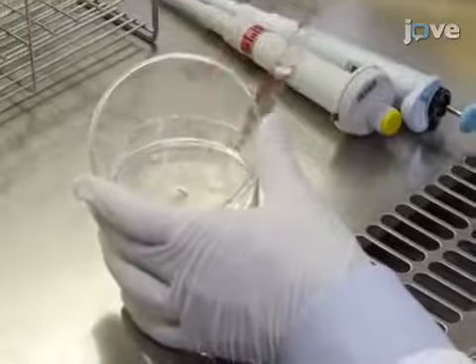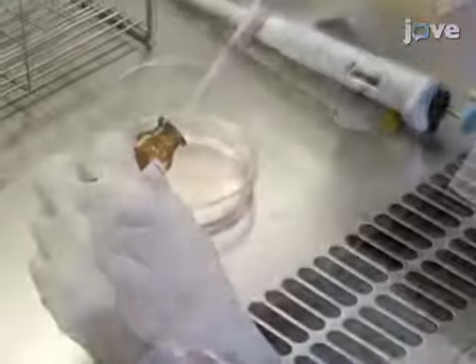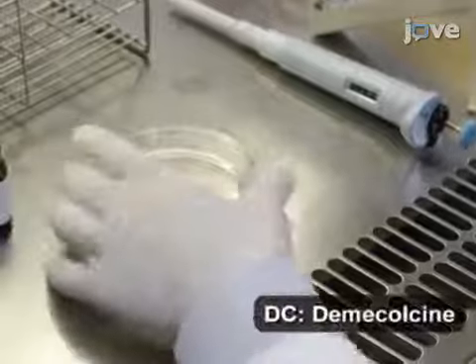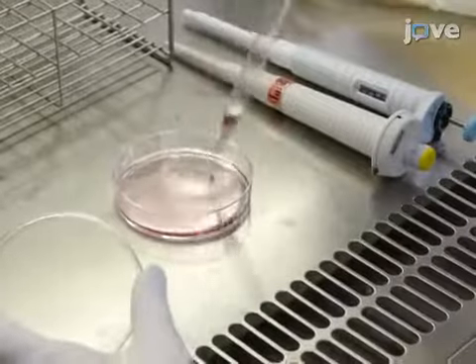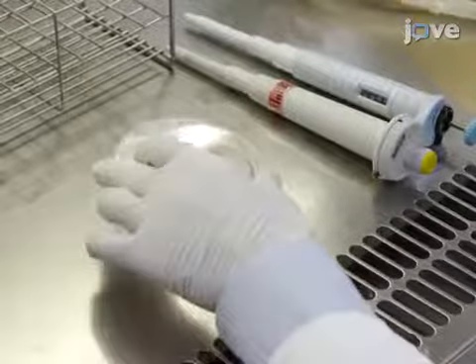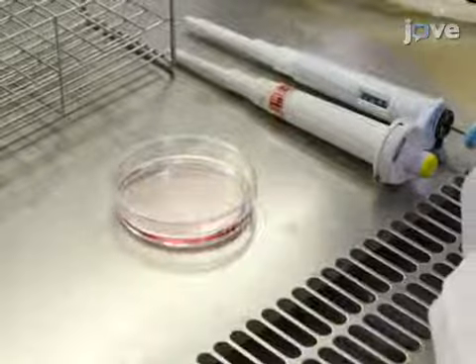After this, treat the exponentially growing cells with medium containing 0.1 micrograms per milliliter DC. Incubate in a 5% carbon dioxide atmosphere at 37 degrees Celsius for 4 days. Then, replace the DC-containing medium with drug-free medium. Incubate in 5% carbon dioxide at 37 degrees Celsius until proliferation resumes.